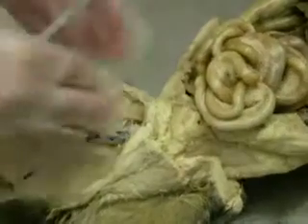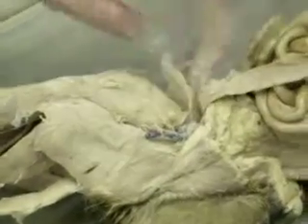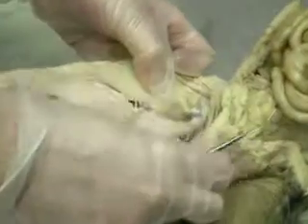It sort of splits in that way. For some reason, I guess there's probably two, but it sort of splits down the middle. Under the gracilis, if you lift the gracilis, you see some of the adductor muscles. These are part of the femoral artery and vein — these blood vessels here.